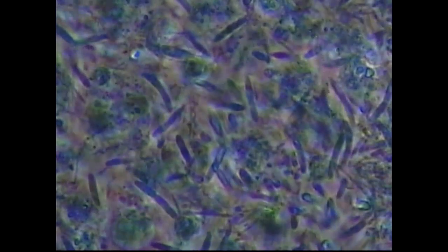I tweaked my microscope a little bit. Don't tell Bill Landers at Orotech I did that. I was instructed not to play with my settings too much, but like any good geek, I just couldn't listen.